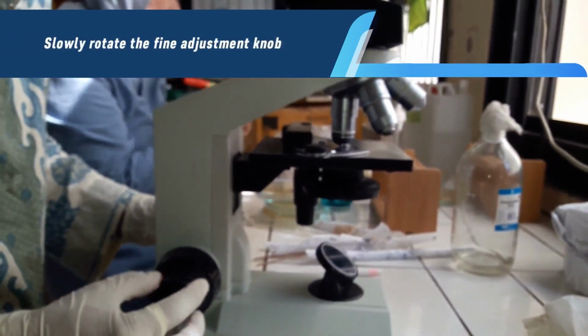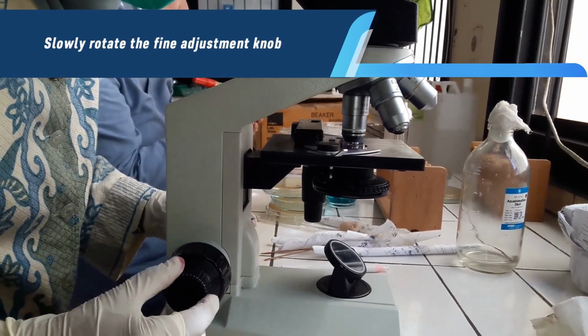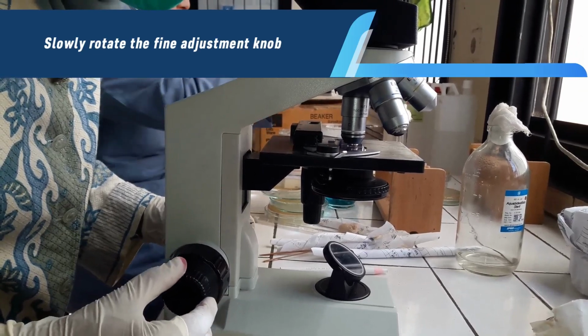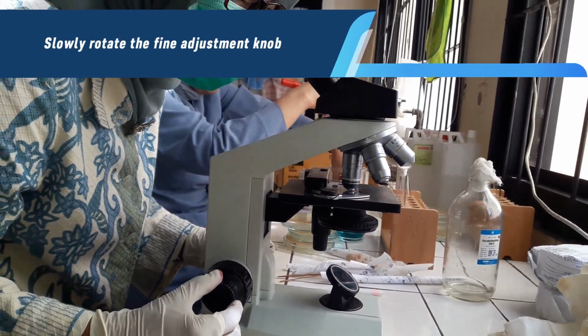Now slowly rotate the fine adjustment knob until you obtain a clearer image of your specimen. You may have to move the slide slightly if the stained cells are at the edge of the field. Once you have the slide in focus, you can move to other fields to see more of the bacteria.